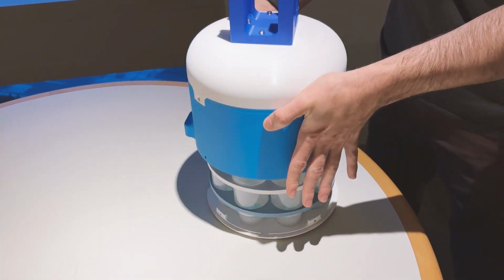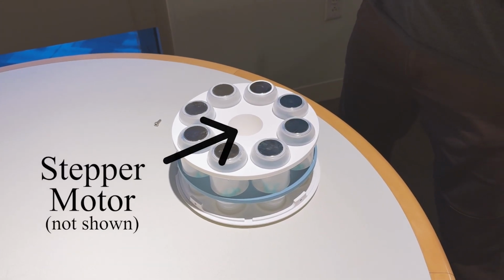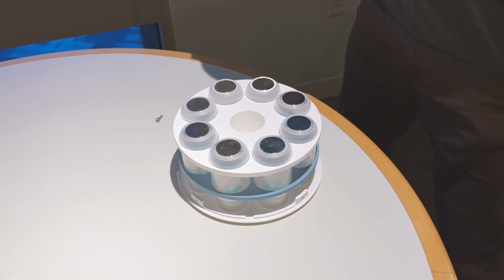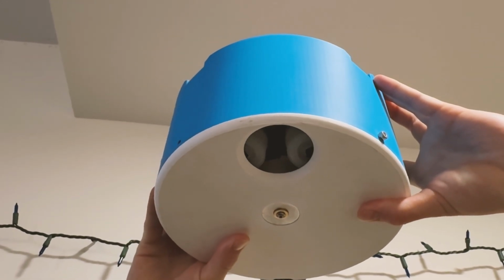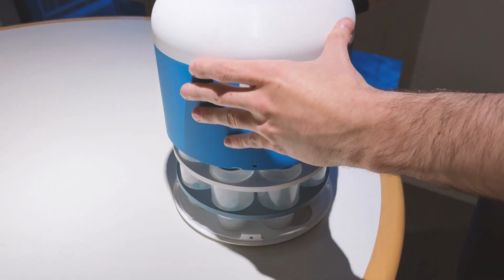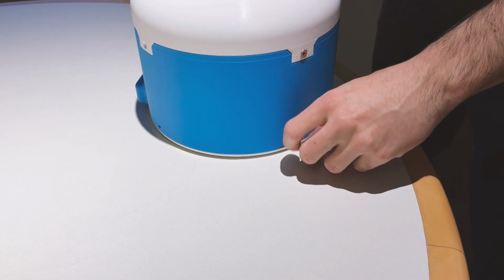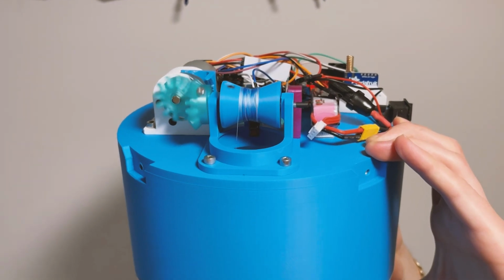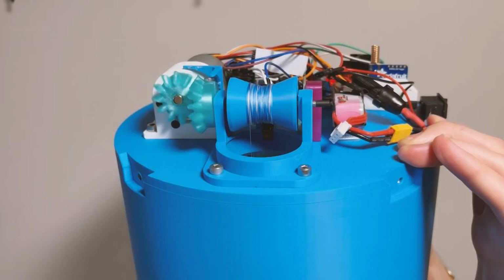The sampling device holds 8 sampling containers in a cylindrical barrel which rotates using a stepper motor to move filled sample containers away and push them into storage, and moves into position empty containers so that filling can commence. The samples can be removed toollessly alongside the barrel and bottom plate. This single lowering mechanism uses a DC motor and a spool with fishing wire to lower and raise the sample.